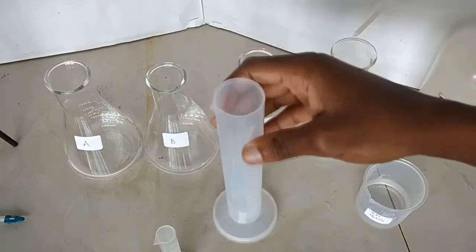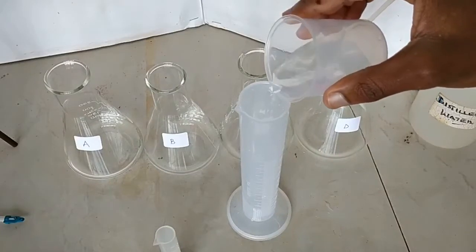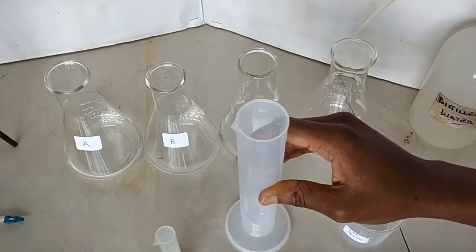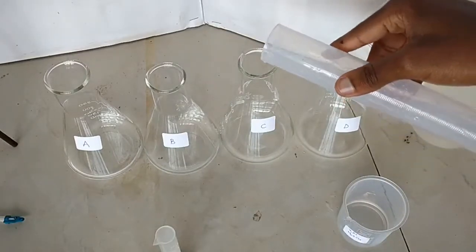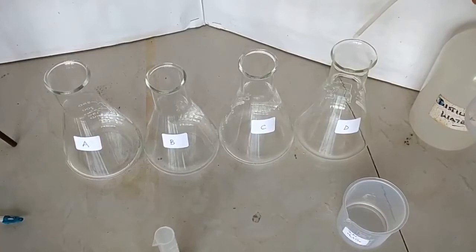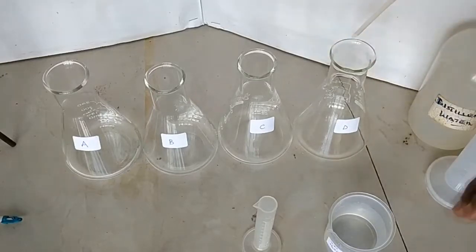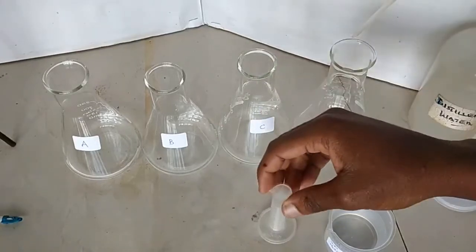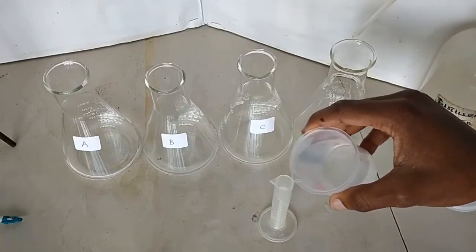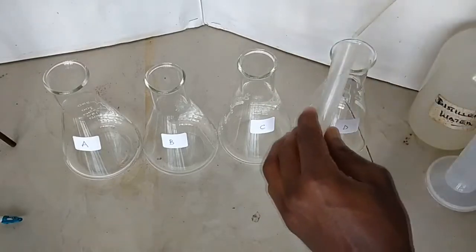Now we go for 20 centimeters cubed in flask C — yes, that's exactly 20. Put that in flask C. And then in the last flask D, we're going to put 10 cubic centimeters, using this 10 ml measuring cylinder. Very well, that's 10 — put it in flask D.